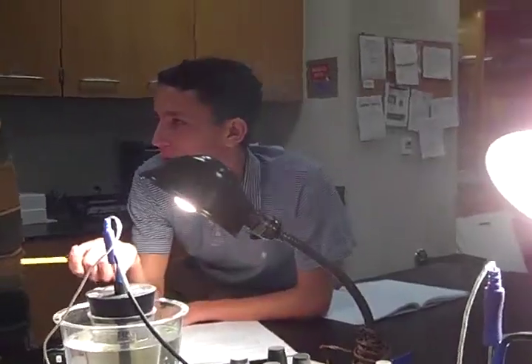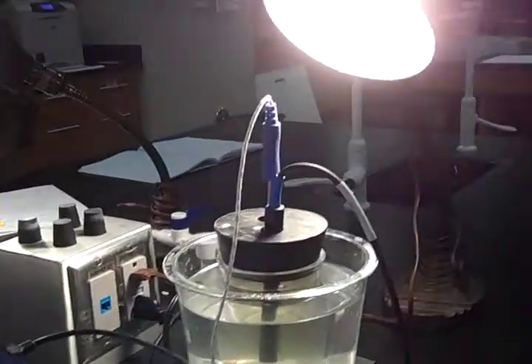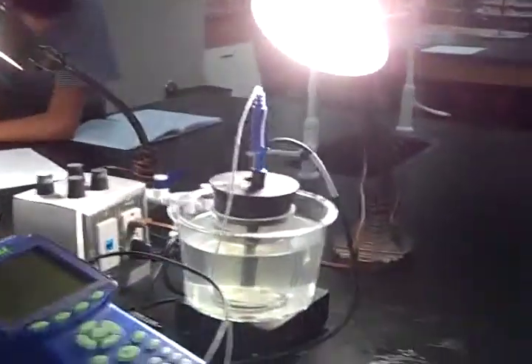Alright, my name's Robert. I'm Steven. And I'm Tim. And we are Loyola APES class doing photosynthesis tests. Alright, so what we're doing here today is we're trying to indicate the factors that affect oxygen production in photosynthesis. So in other words, we're trying to see if anything in a certain environment affects the oxygen levels.